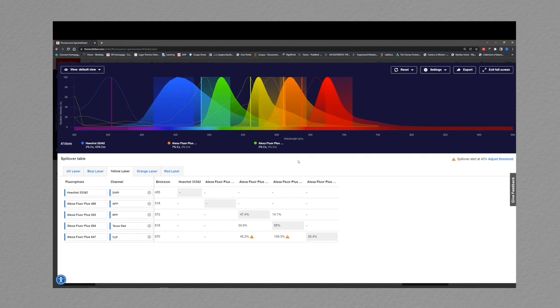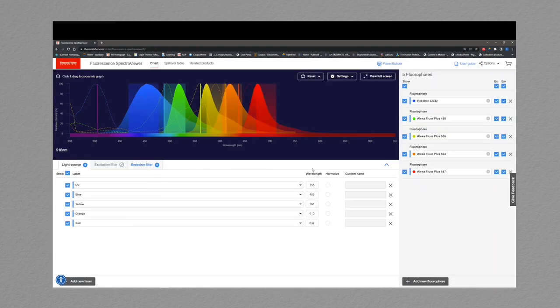Lastly, let's go back to the SpectraViewer. An important feature of SpectraViewer is the ability to normalize your spectra depending on your chosen laser. If you click on the little radio button next to the laser, it can show the relative amount of emission of all the fluorophores within a given laser. Hopefully this tutorial has taken some of the guesswork out of fluorophore selection and will allow you to multiplex with confidence into the 5 to 8 color panel design.